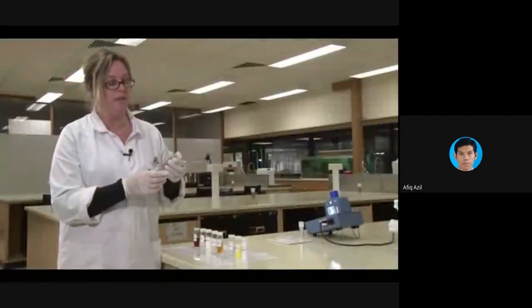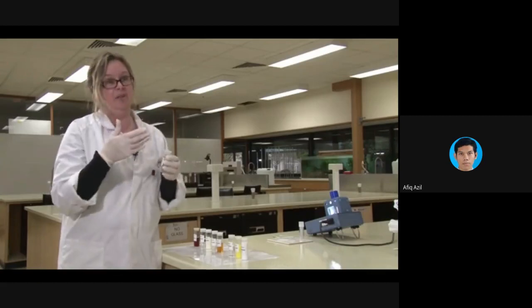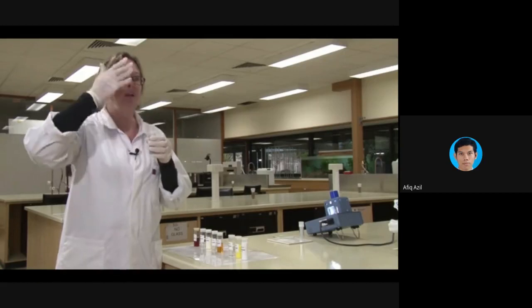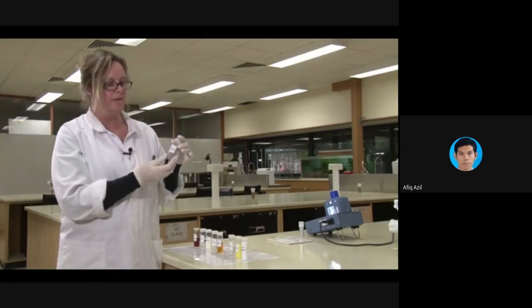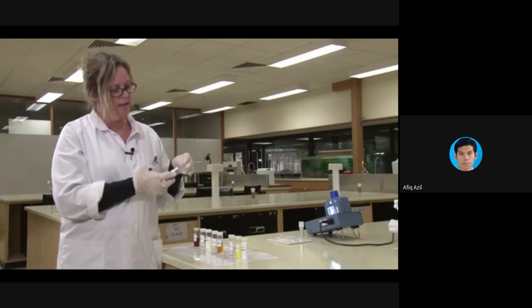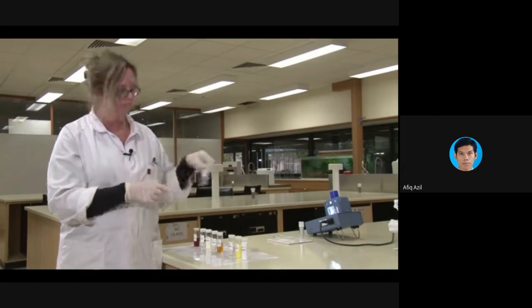Another thing that you can do is identify the odour of the compound. You don't want to take a very big sniff of organic compounds, but if you use the wafting technique and just slowly inhale the odour of the compound, things that smell really fishy quite often are amines, and things that smell really pleasant can be esters.